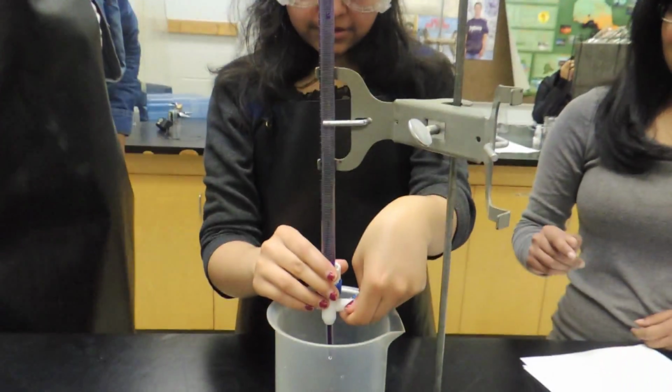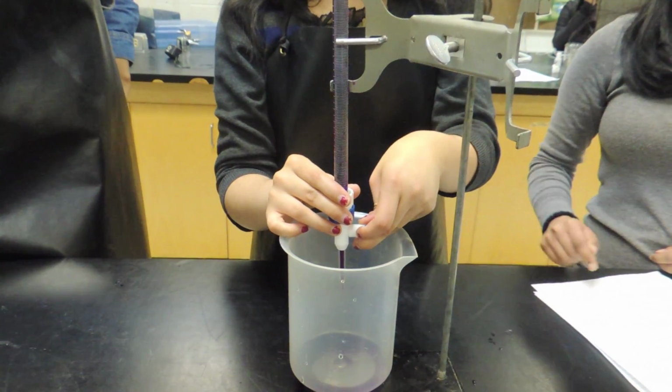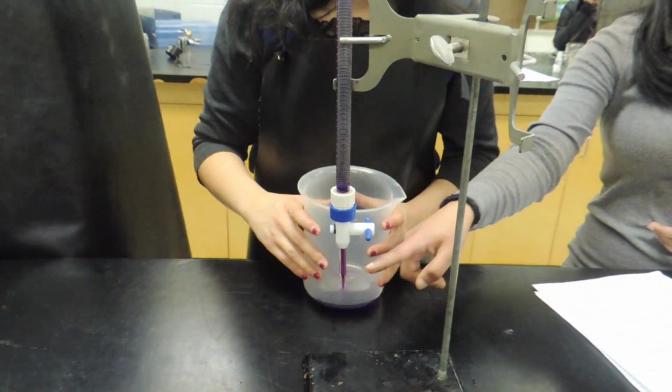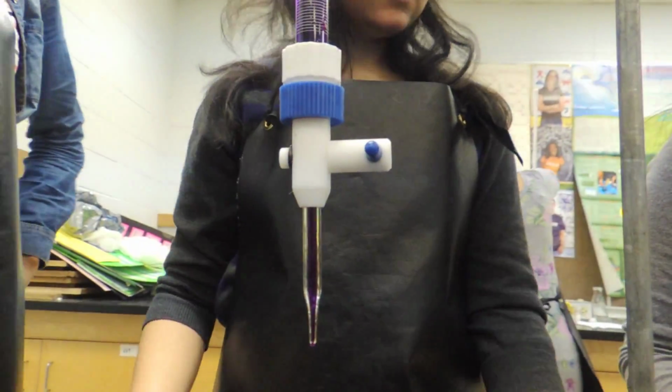Another source of experimental error can be air bubbles in the middle or tip of the burette, which will result in an inaccurate burette reading. In order to get the bubbles out, open the stopcock and drain some liquid out of the burette. If there are bubbles in the burette above the tip, gently tap the side of the burette and the gas bubbles will rise to the top and out of the burette.